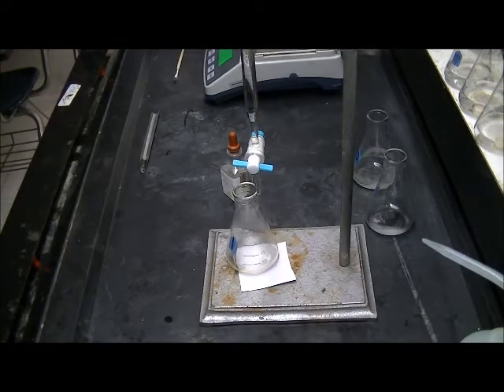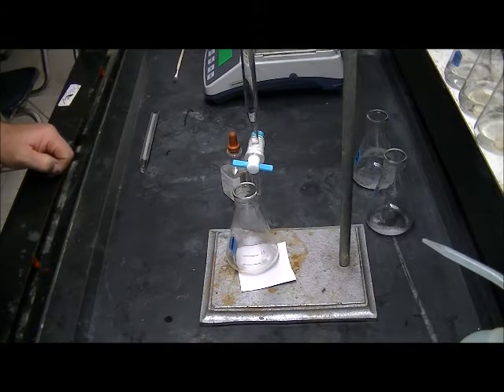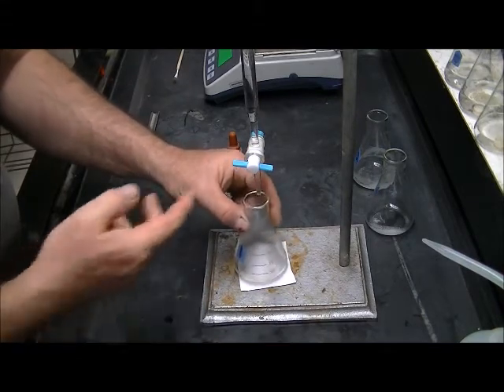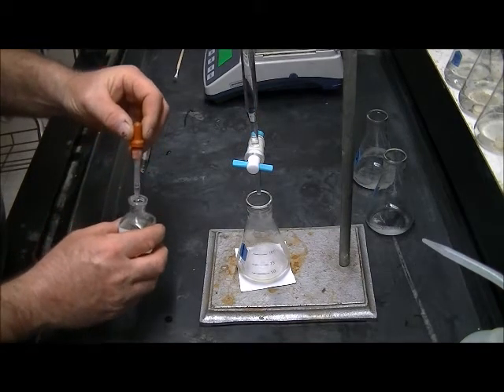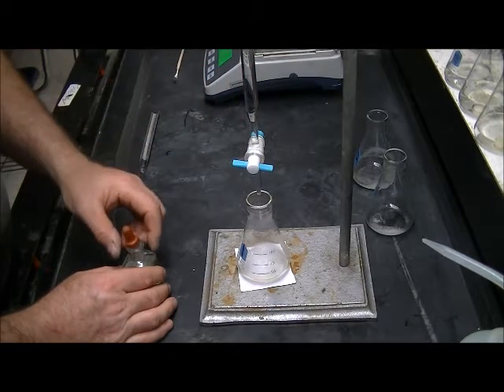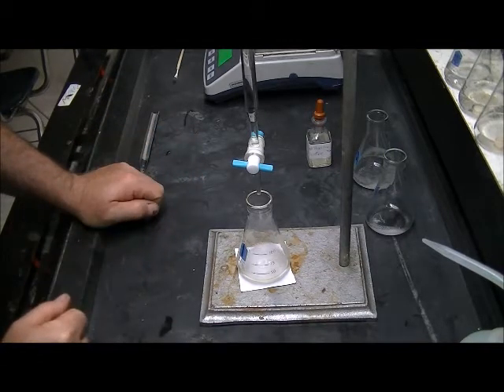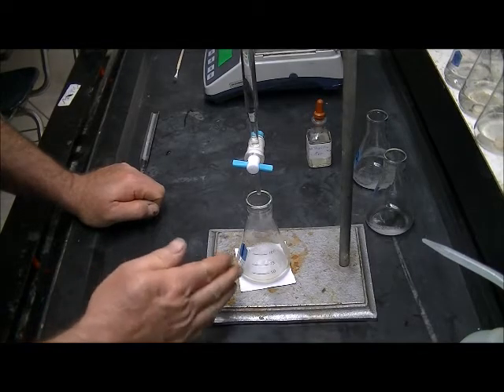My burette has been rinsed and filled as we did in class. The liquid level is right at the zero mark at the top of the burette, and I've adjusted the burette in the stand so I can freely move the flask around under the tip without damaging it. The indicator we're using this time is called phenolphthalein. It will be clear at first, and the endpoint will be indicated as it turns pink. We want a very light pink at the endpoint — not an intense pink. We want to catch it just when it's turning colors.